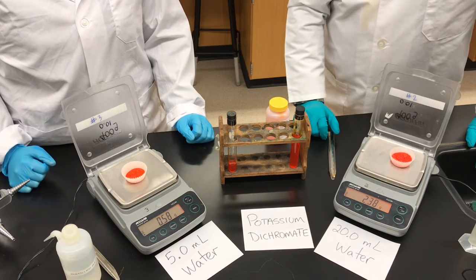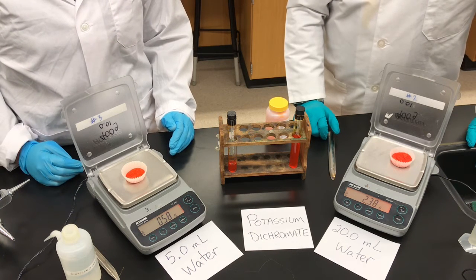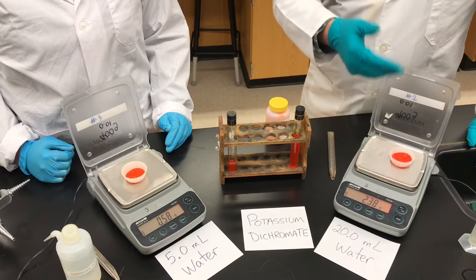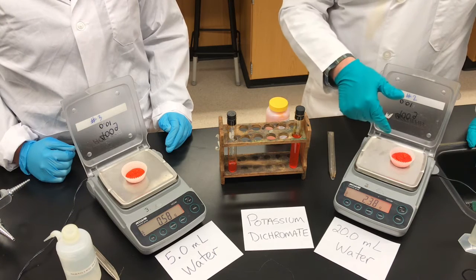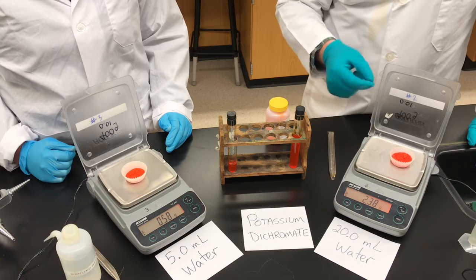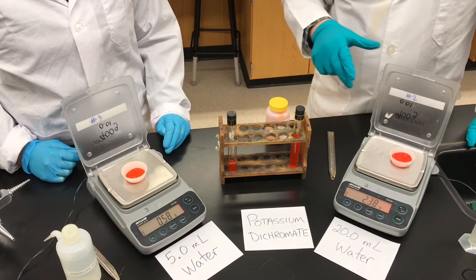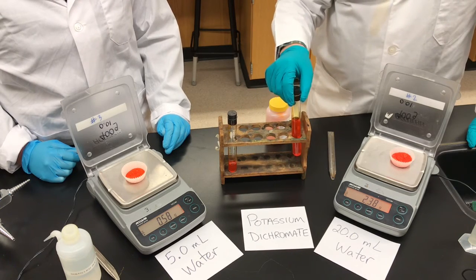From this we can determine something called the concentration. Concentration is given by the formula: mass of the solute divided by the volume of the solvent — in this case water — times 100. That gives a value measured in grams per 100 milliliters of water. If we just divided mass by volume we'd get grams per milliliter, which sounds like density units. The difference is that the mass refers to the mass of the salt while the milliliters refers to the milliliters of water — in a density calculation, mass and volume refer to the same substance. You can use our data to calculate the concentration of both saturated solutions.